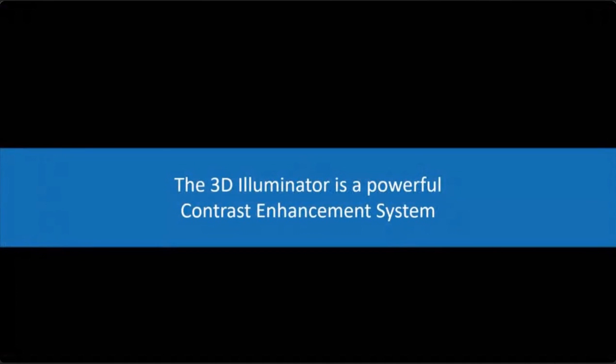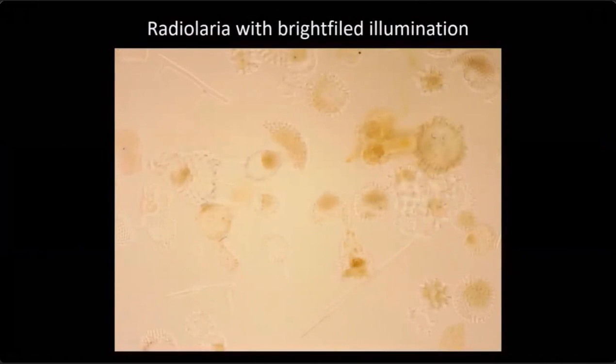So the illuminator, first and foremost, is a powerful contrast enhancement system. A lot of you may have things like DIC Nomarski hooked up to your microscope, or phase contrast. Those are powerful contrast enhancement systems, but so is oblique illumination. So take a look at this picture of radiolaria. Radiolaria are not stained, diatoms and so forth are not stained. If you look at it with a bright field microscope, this is what you see. It's not a great image.